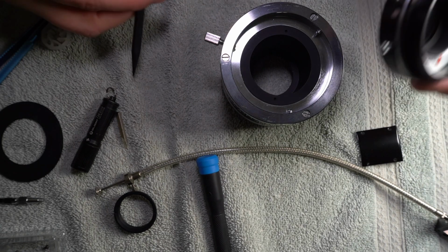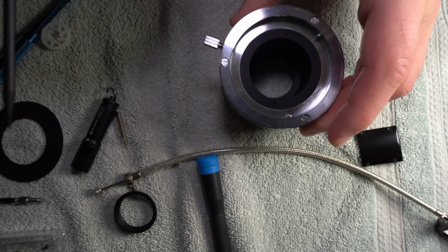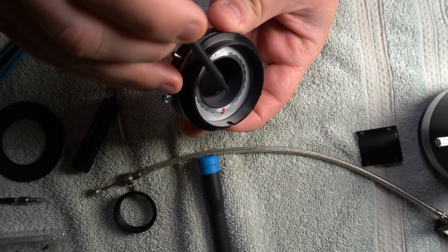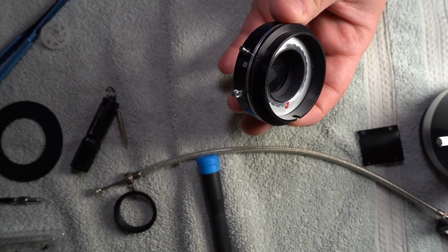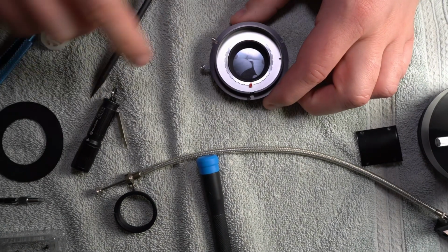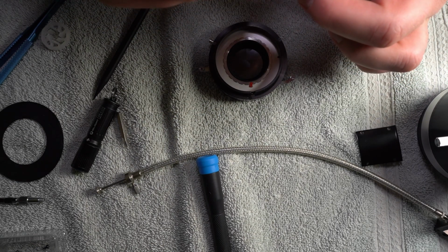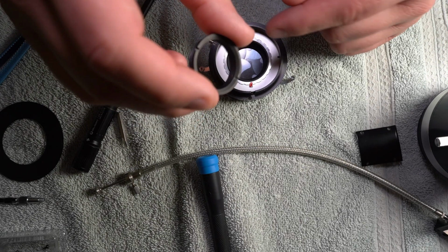Okay, so now there are threads in here as well, and I'm going to, not easy to do this. There's threads in here. I don't know how well you can see them. Maybe if I focus. Don't know if that helped or not, but there's threads in there. Take my word for it. And that's what this thing goes on. And it's funny because there's actually, oh no, that's not threads, I guess. There's actually thread looking things on the inside of this spanner nut, and that's what this is too.